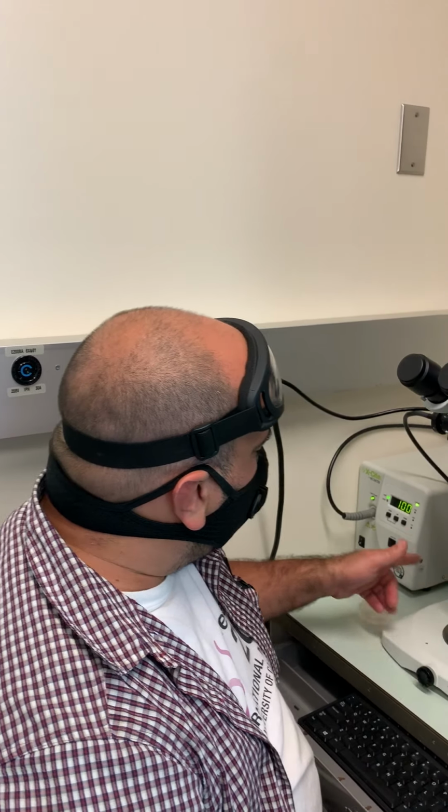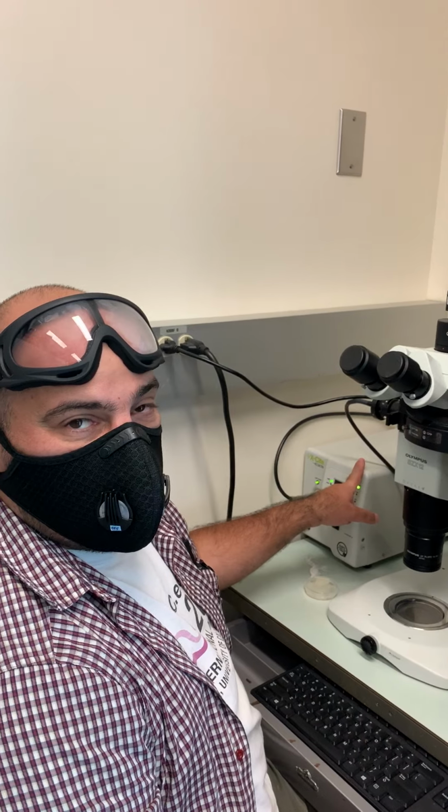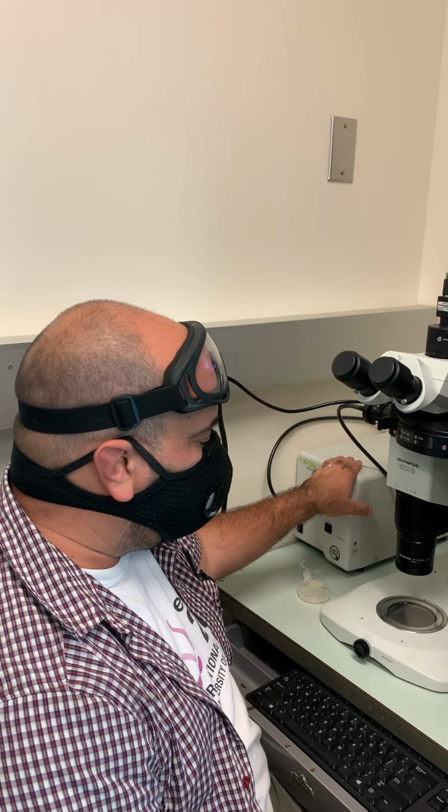Once you're done, make sure that you let somebody know so they can turn off the machine, the light source at the end of the day. Okay, thank you.